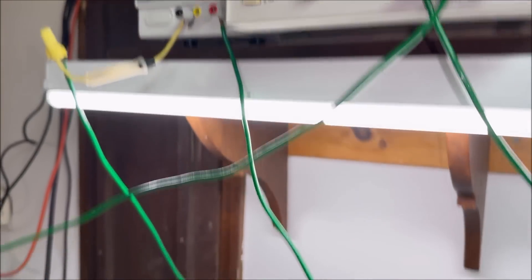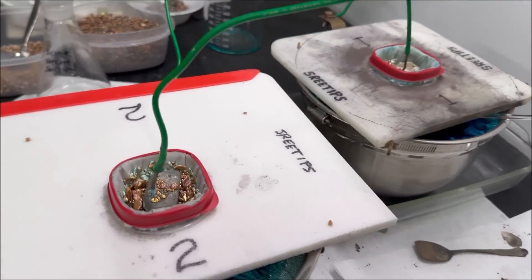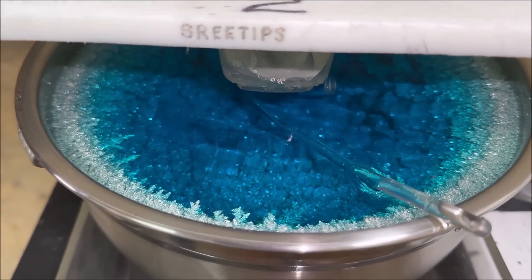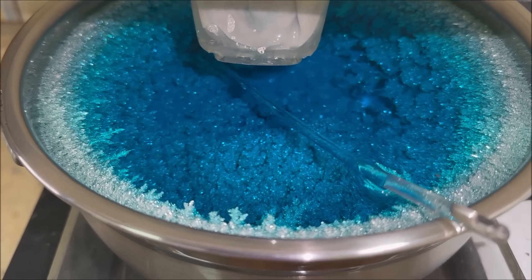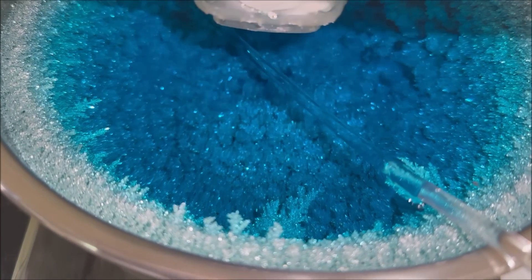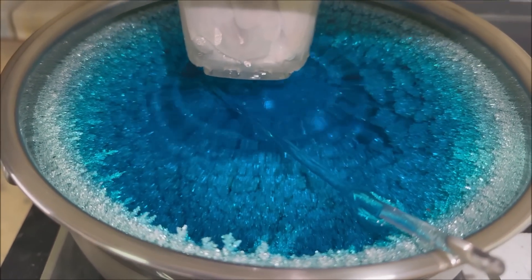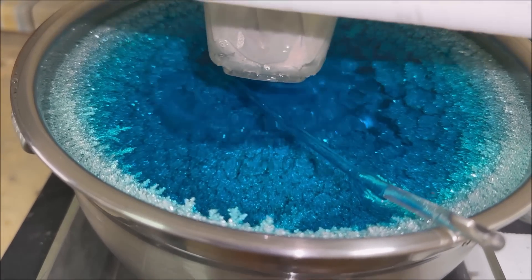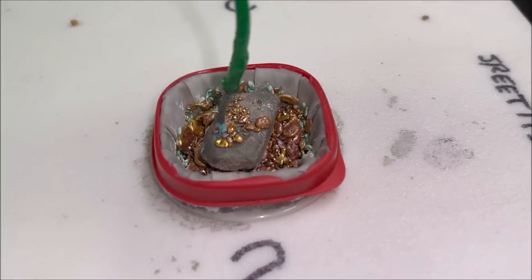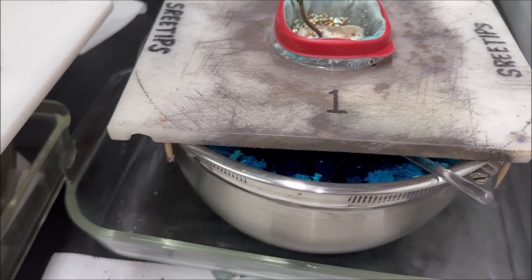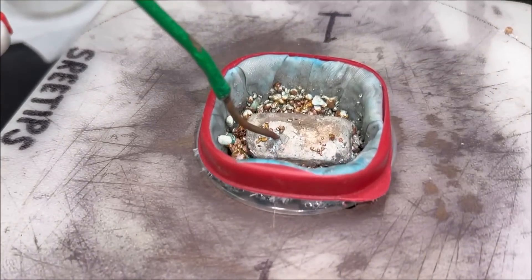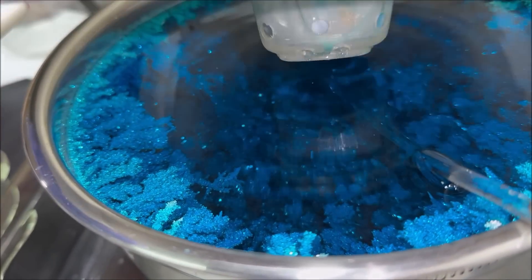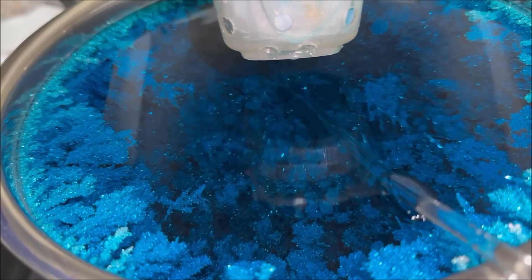While I'm waiting for that gold to dissolve, it's probably going to take about a half hour, let's take a peek down inside my silver cells to see what kind of progress we're making. Oh my goodness, look at that! This is silver cell number two, it's been running for about three days now with the new power supply. That looks awesome. And over here is silver cell number one. This one's ready, I'm going to have to harvest the pure silver out of here. It's getting too full.